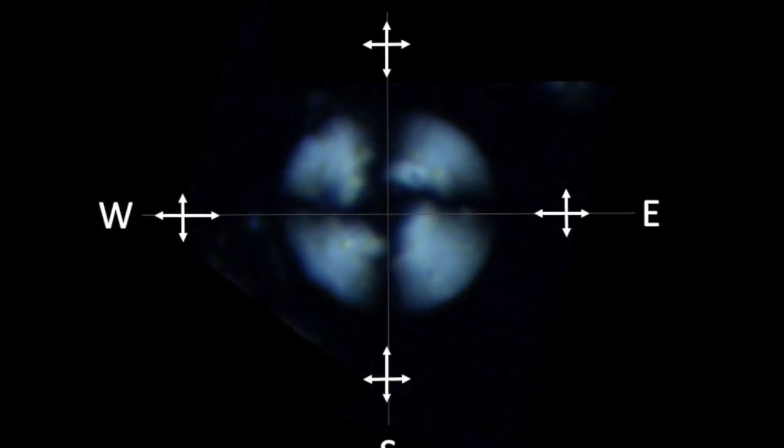Combined, they produce the two black extinction lines that cross in the central area, also black in this case because it's void of crystals. Note that the pattern is maintained even when we rotate the coccolith, which means that it is radially symmetrical. Note as well that while we rotate the calcareous nanofossil, it loses focus, and we need to focus it again. It's a bit annoying when we see it here on video, but don't worry, when observing them at the microscope, after a while, you'll not notice this. With time, you'll even get used to continuously focusing and defocusing a bit with the fine focus knob. This is useful to get a perspective of the third dimension of the calcareous nanofossil.